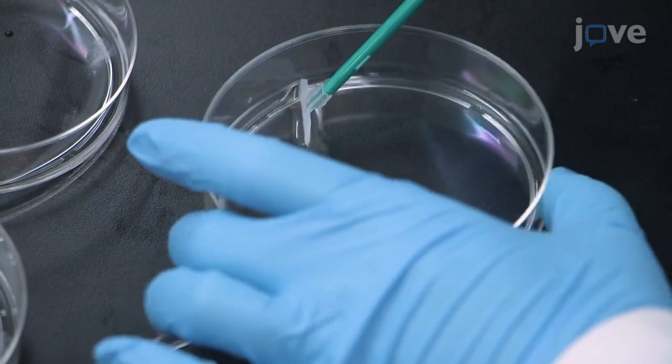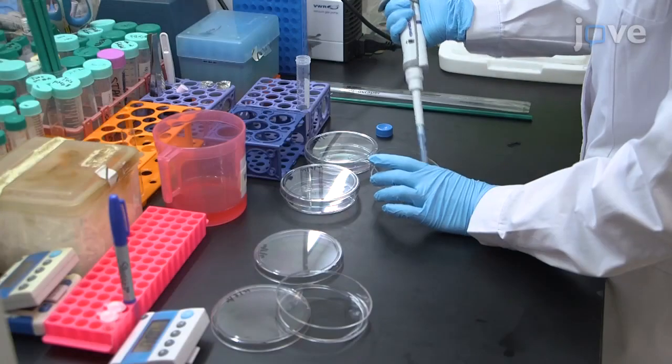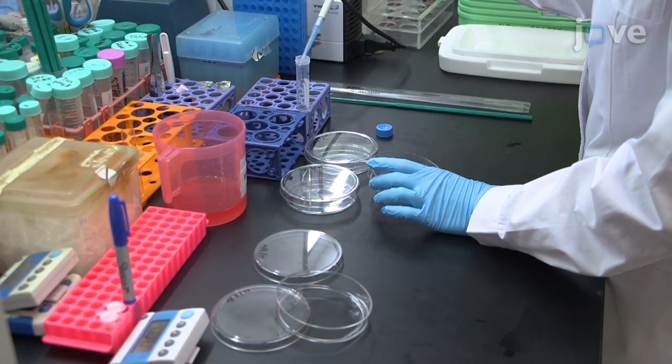Next, using a cell scraper, collect the cells and transfer the cell suspension to a 15 mL centrifuge tube.